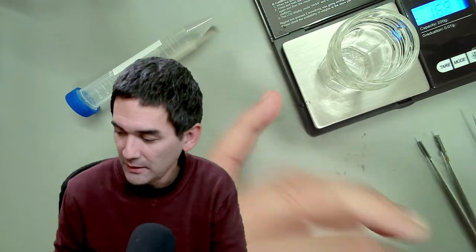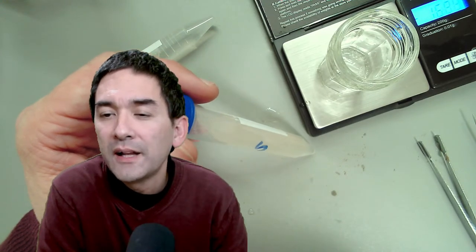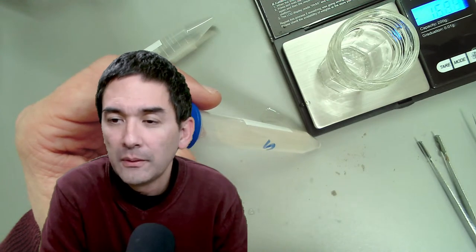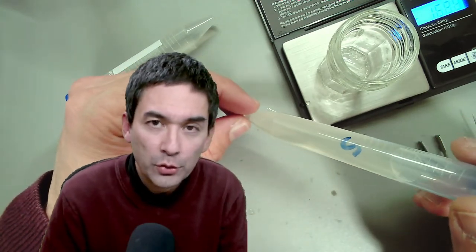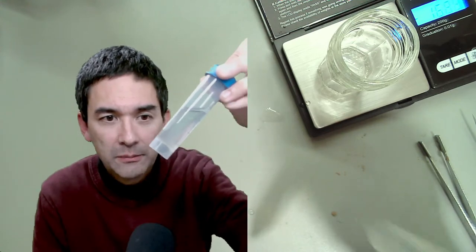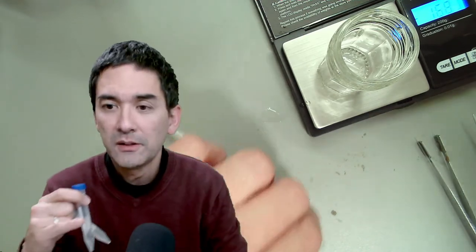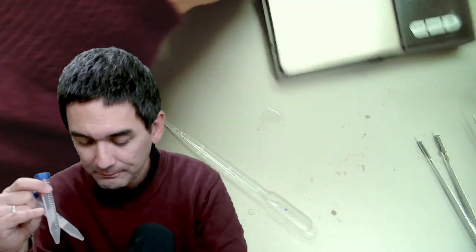I use a permanent marker to label the sand sample tube with 'S' so I know which is which. Checking more questions — alcohol and water cannot be separated by centrifuging because they dissolve in each other. The sand sample is from northern Germany and the other sample is from a local small river collected today. I haven't tried either yet, so I don't know what to expect.